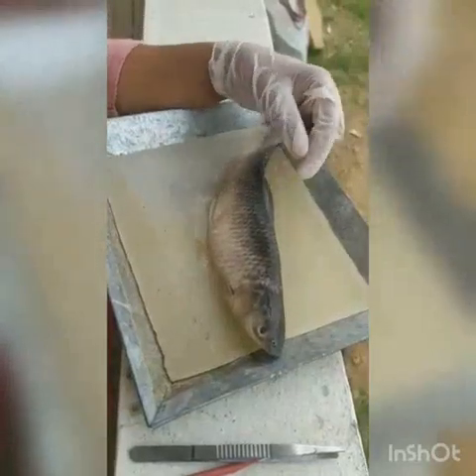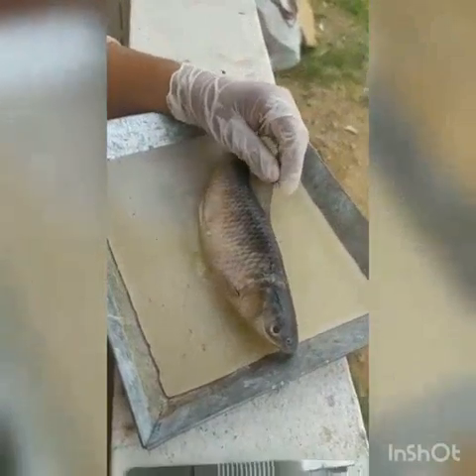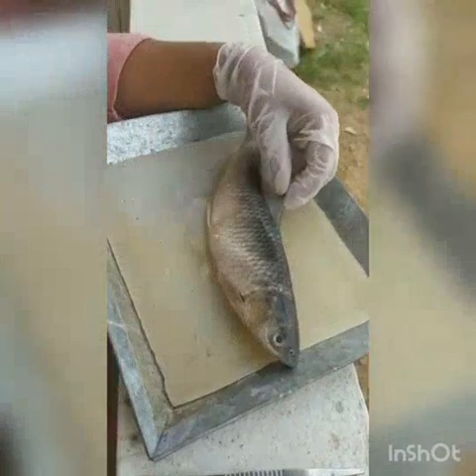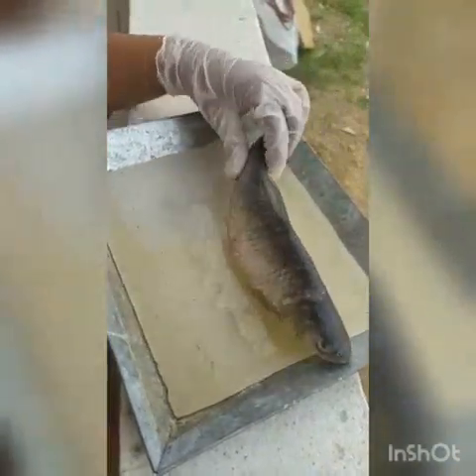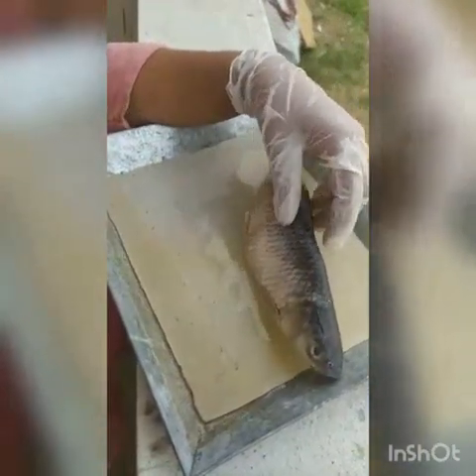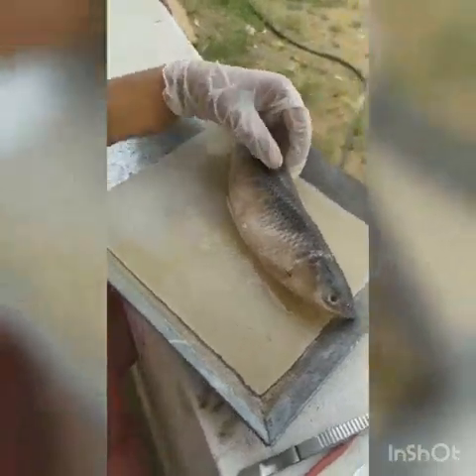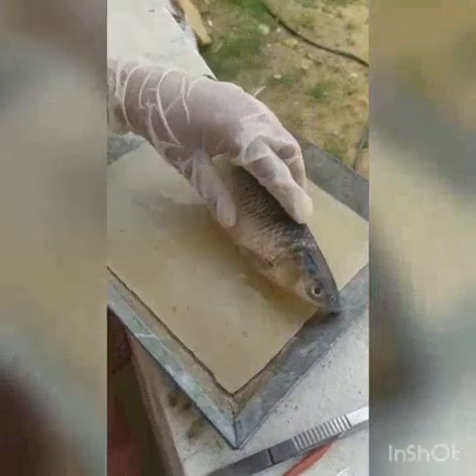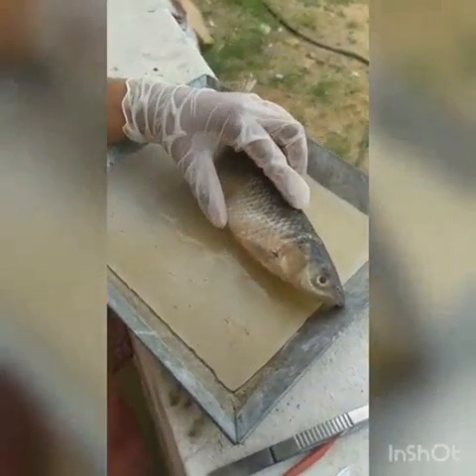Good morning everyone. Today we are going to dissect Labeo rohita to get the Weberian ossicles. Before starting the dissection, let us know a few points about Labeo rohita. It belongs to the kingdom Animalia, phylum Chordata, class Actinopterygii, order Cypriniformes, family Cyprinidae, and the genus is Labeo.